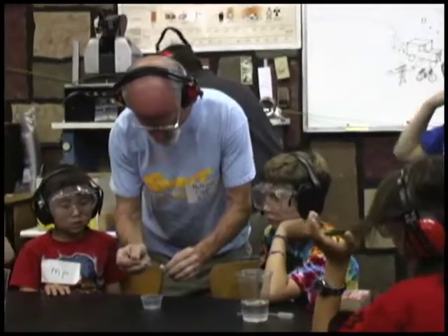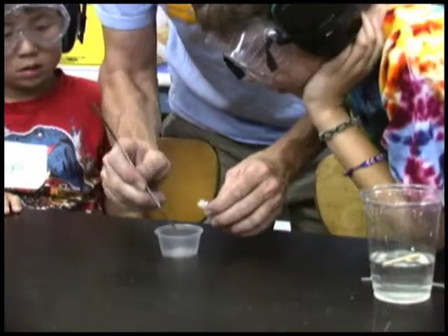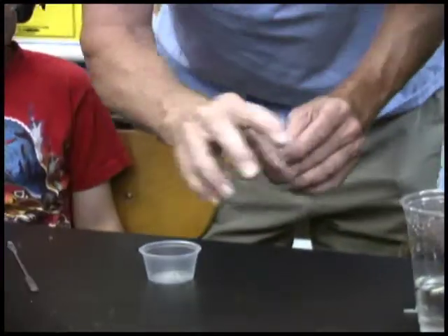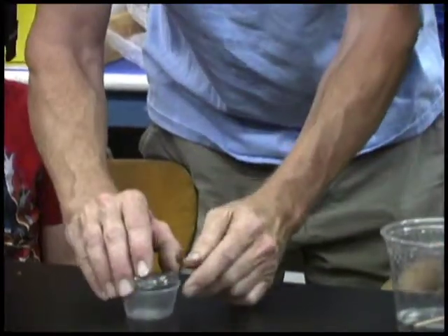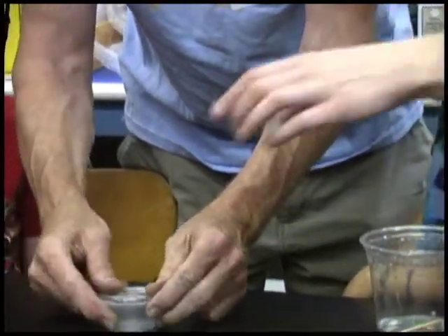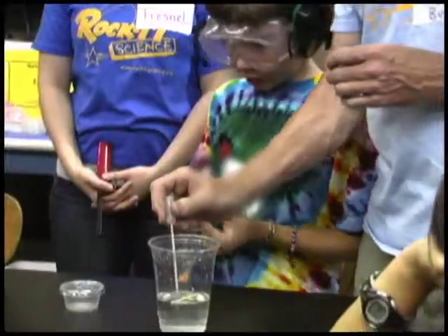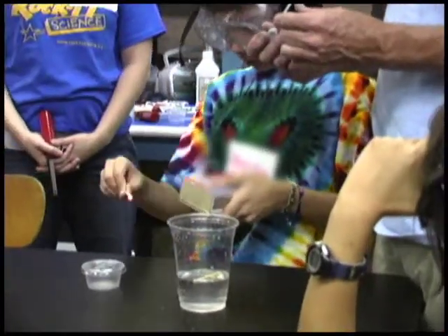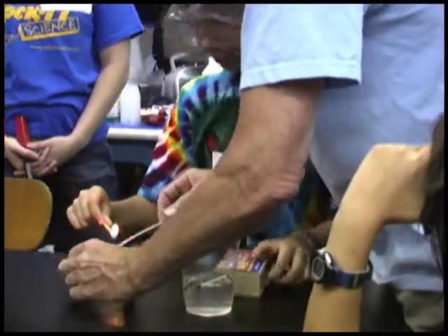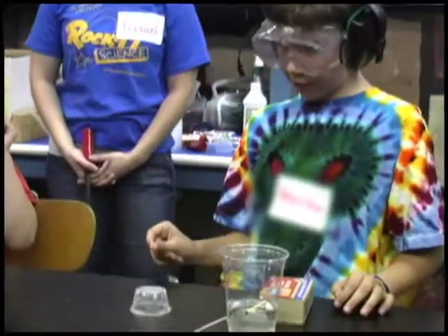Let's just try the end of this scoop. That's just dust. Share it — you get two scoops. Where's your lid? You've got no lid? I borrowed one from his neighbor. Let's put you out if you catch on fire. I'll squirt the water in and you light the match — see if you can get the match going first. Woohoo! Good job! Good job.